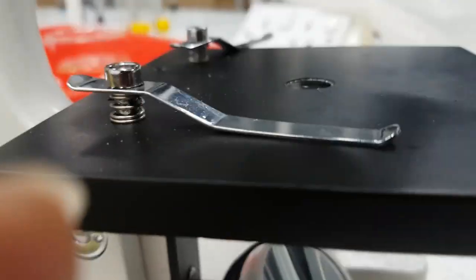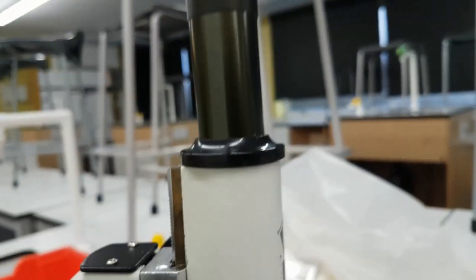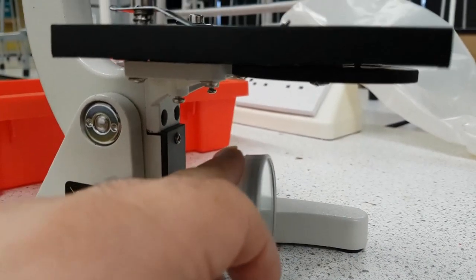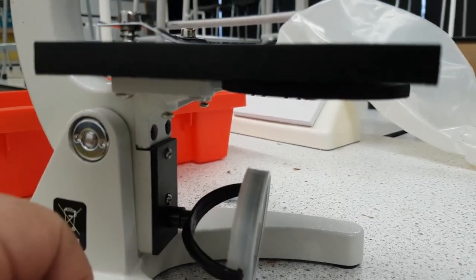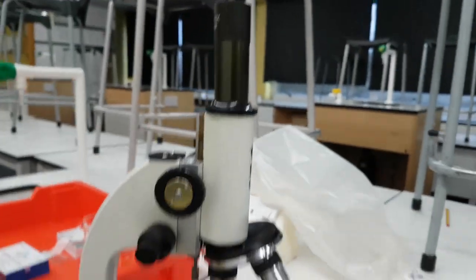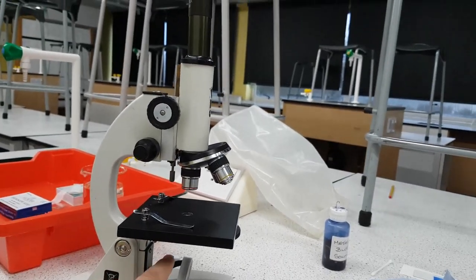So that's the first thing you need to set up and the way you know you've got a lot of light going through is you look through the eyepiece. So what I do, what I like to do is I like to hold that, place that away from any light source and look through there, look through the eyepiece.